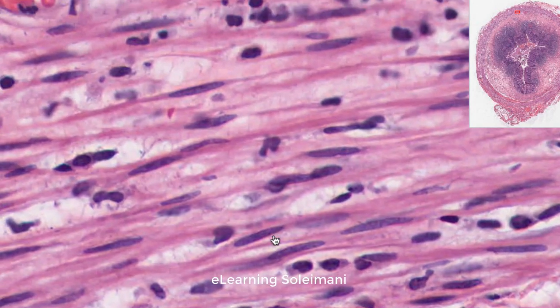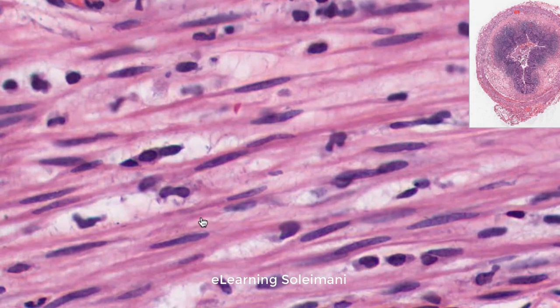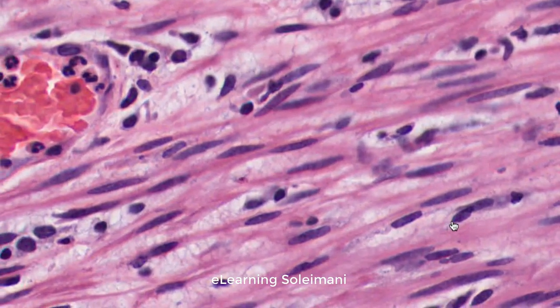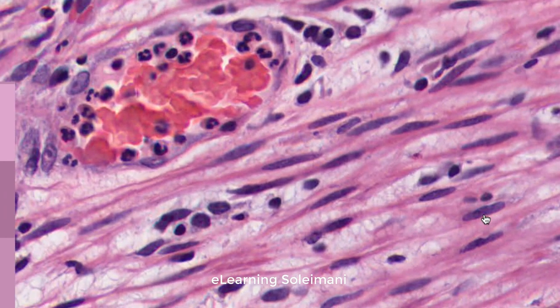In this slide you can see the smooth muscle cells in longitudinal section. Blood vessels and loose connective tissue can be seen between them.